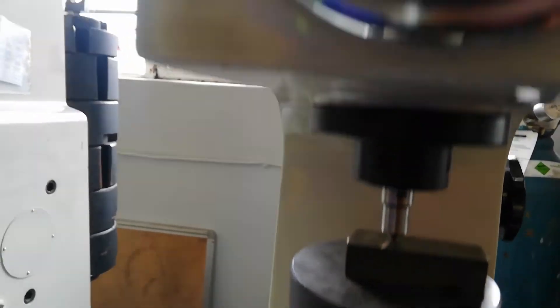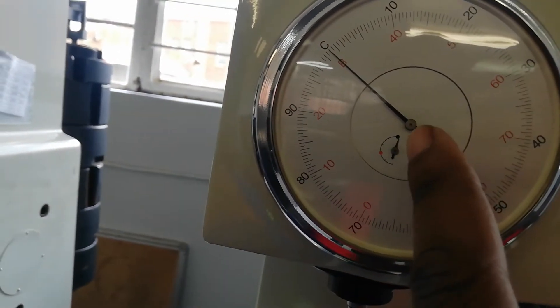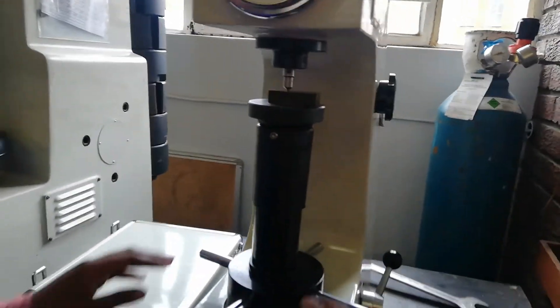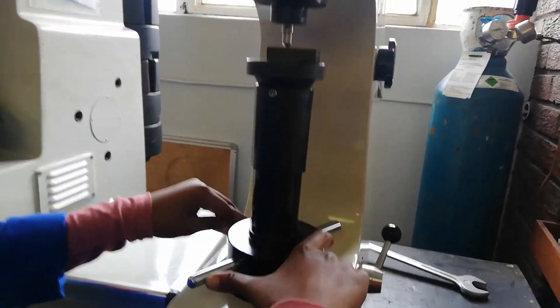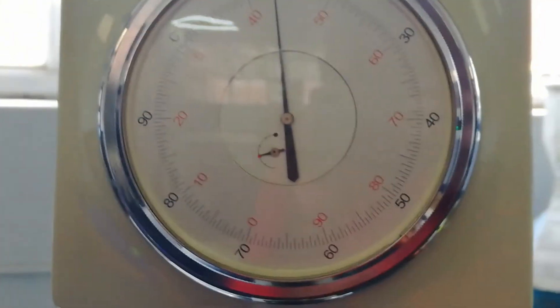She touches the sample. So what we're going to do, we're going to make sure that this small pendulum here moves from the black dots to the red dots. Look at what she's going to do now. There we go — she just goes straight up until it touches the end.